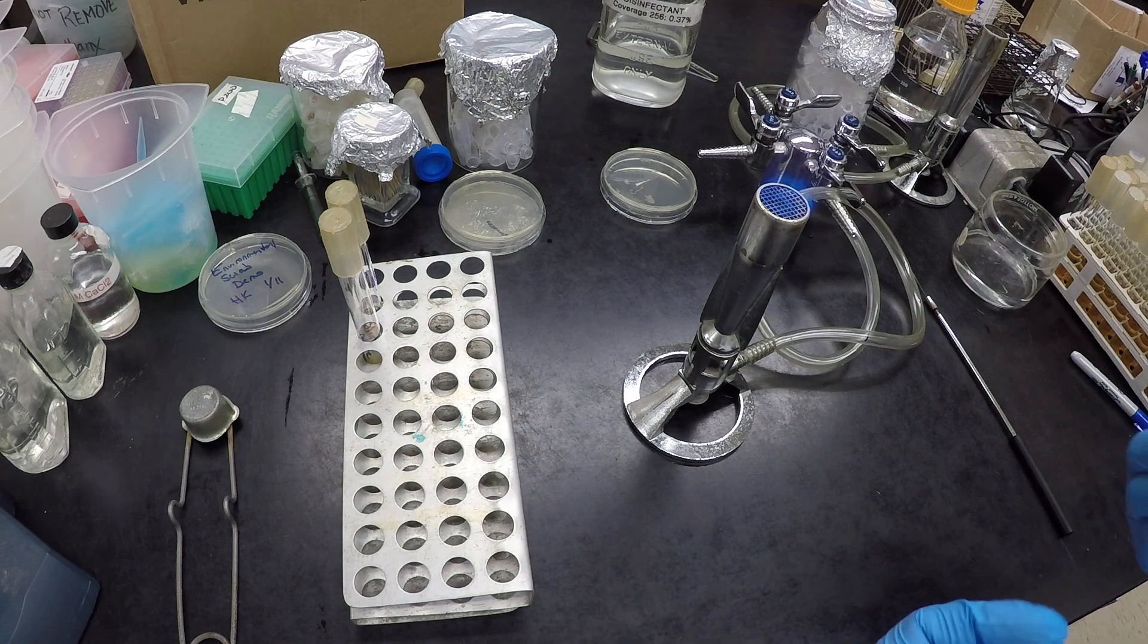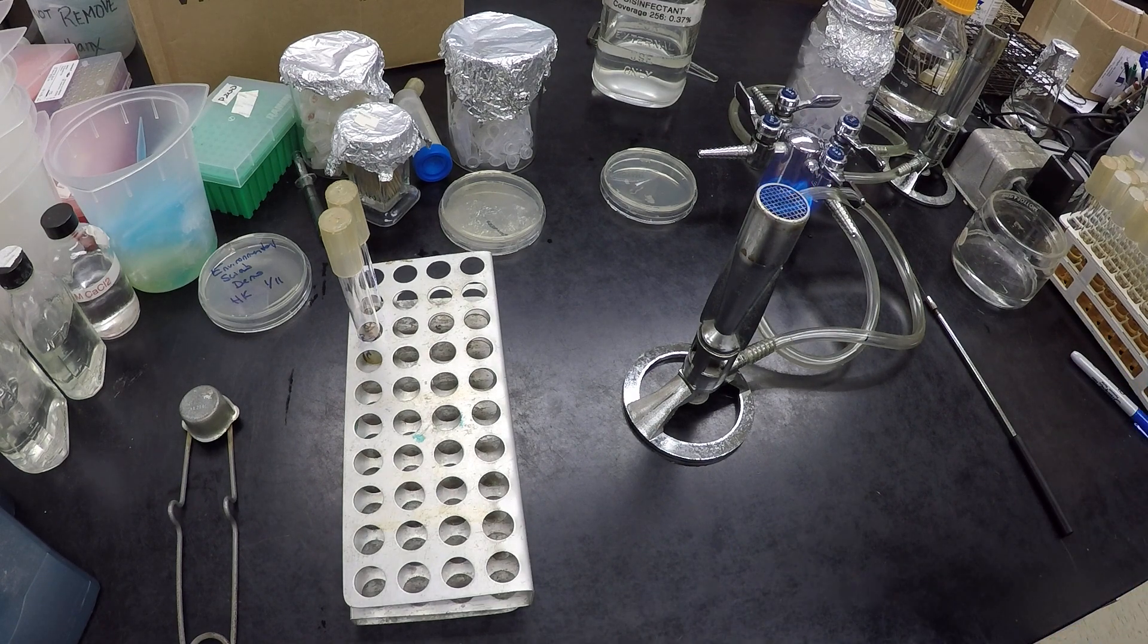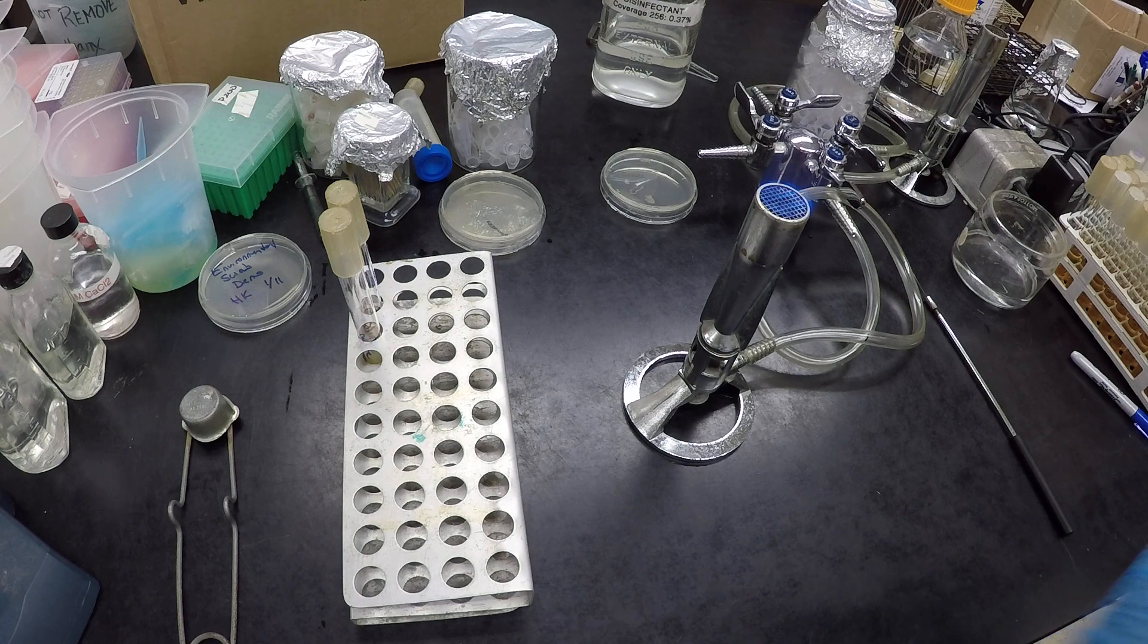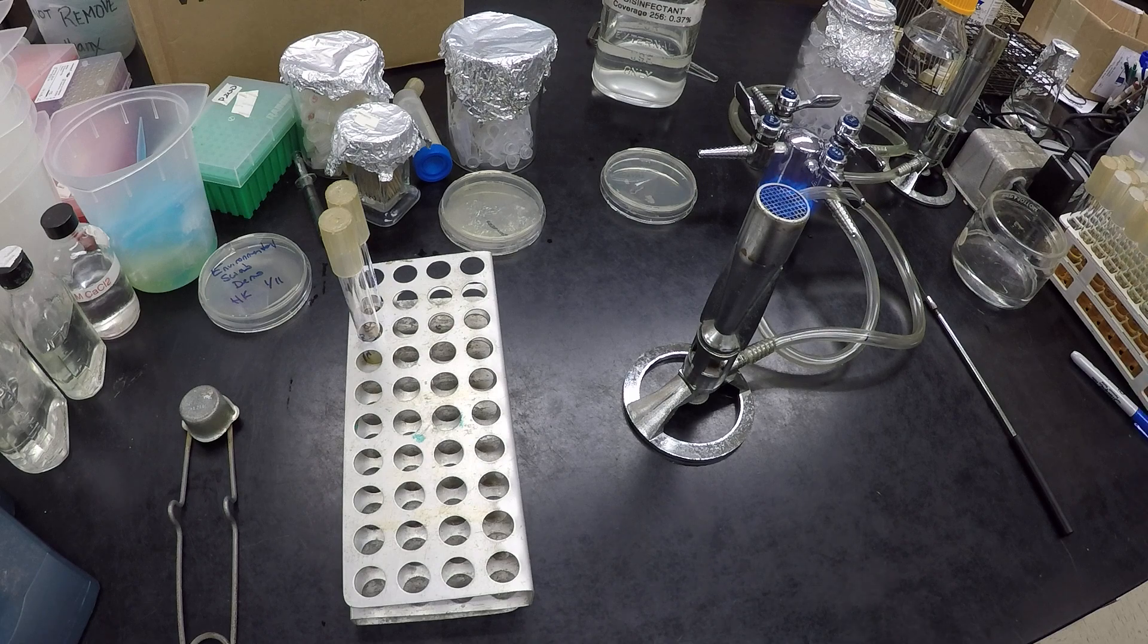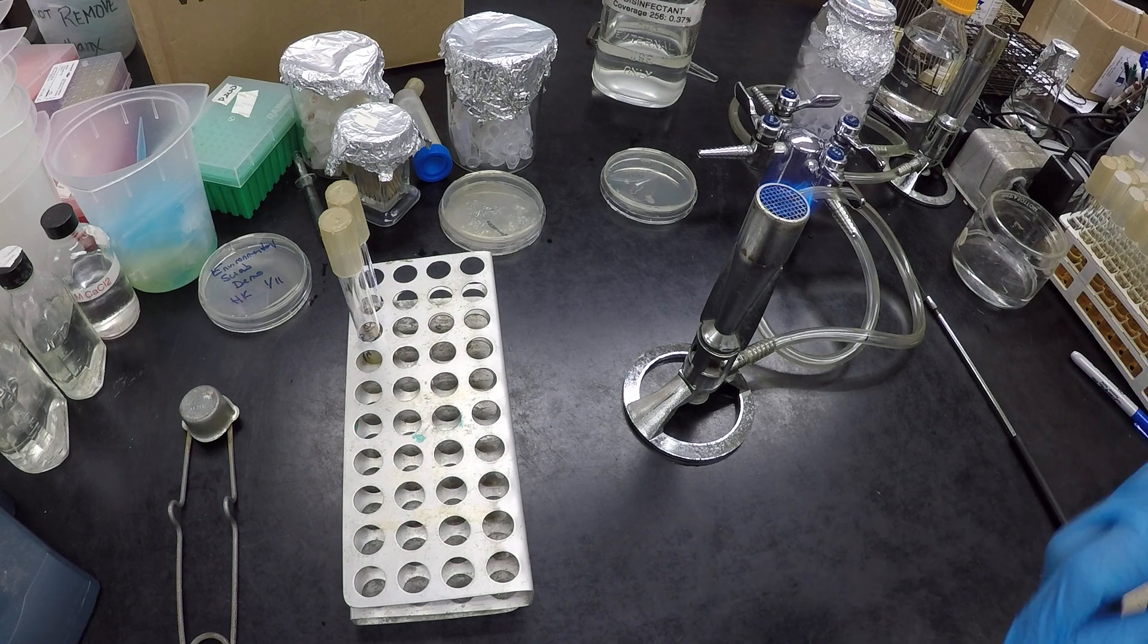The very first type of inoculation that we're going to learn are tube-to-tube transfers. So we're going to inoculate, which you should know means that we're going to introduce a small amount of live bacteria to a sterile medium.